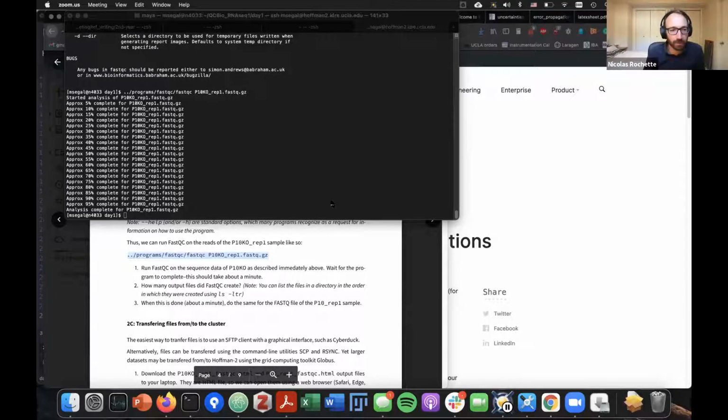So did anyone have problems with running it? Yeah. So the program here just informs us on how far it is into the file. And again, this is very fast, but as I mentioned, sometimes some of these programs are going to run for several hours, and you're pretty happy to know whether you are at 90% or at 20% after 2 hours. Because if you're at 20% after 2 hours, then it's not going to have your results.